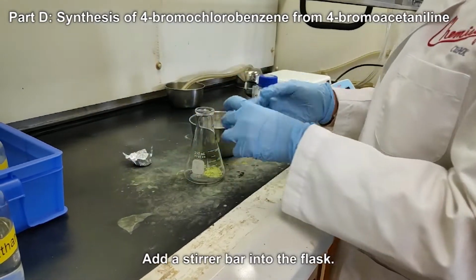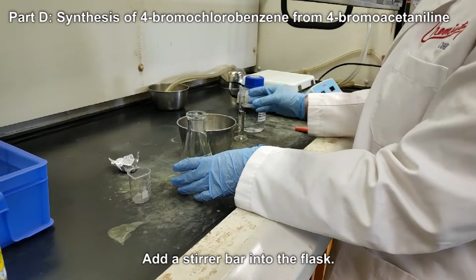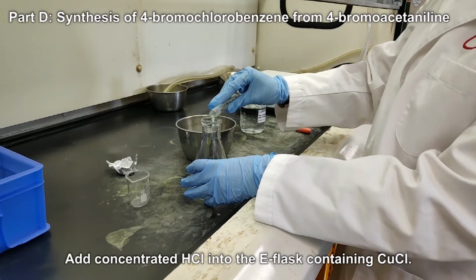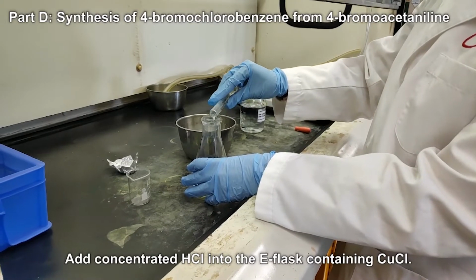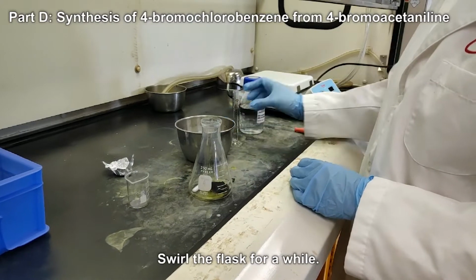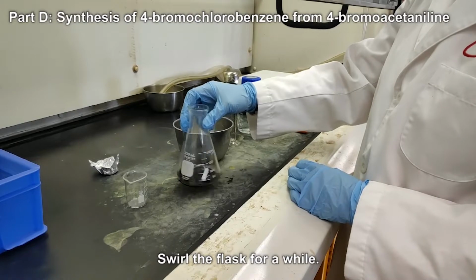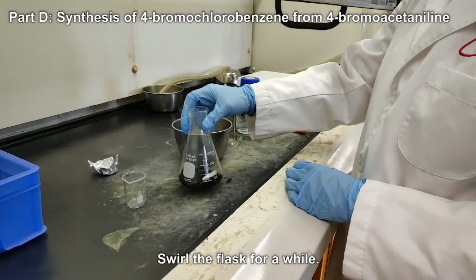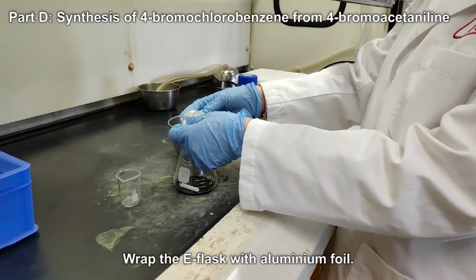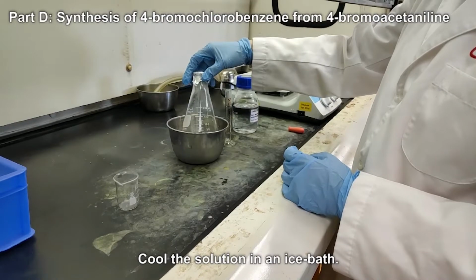Add a stirrer bar into the flask. Add concentrated hydrochloric acid into the E-flask containing copper(I) chloride. Swirl the flask for a while. Wrap the E-flask with aluminum foil. Cool the solution in an ice bath.